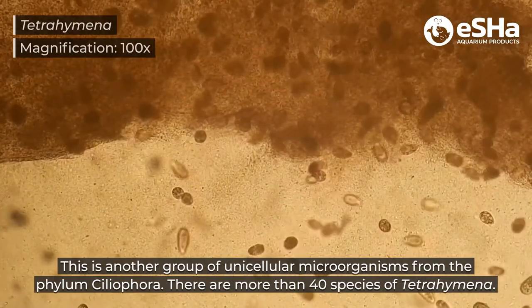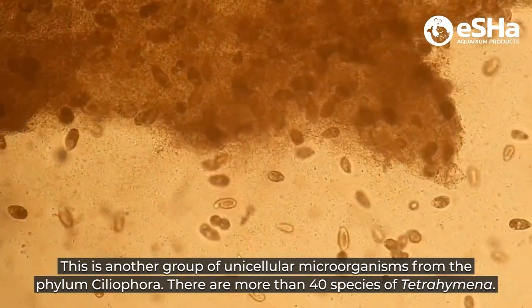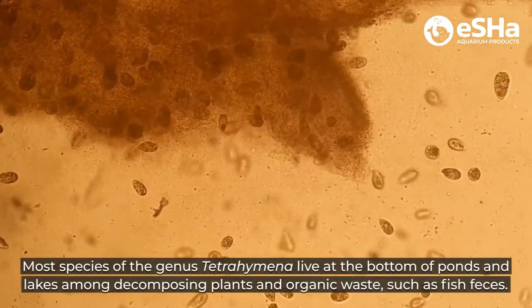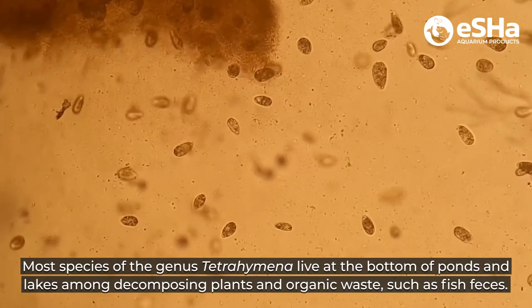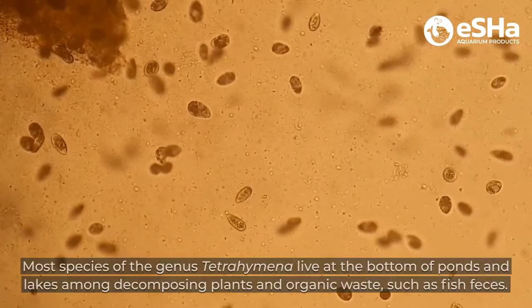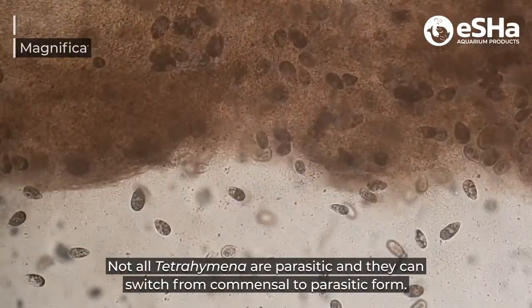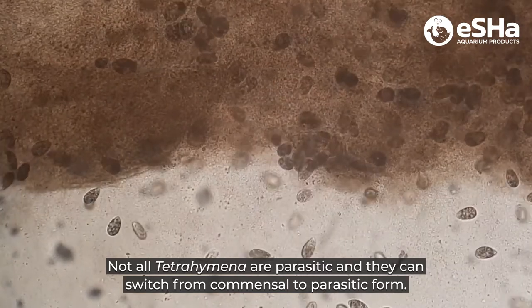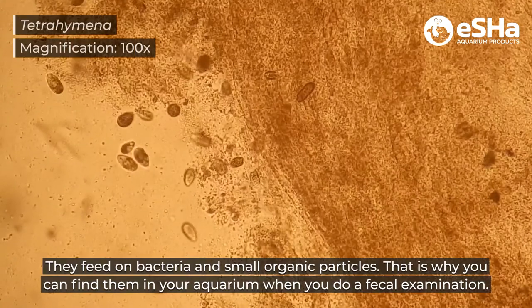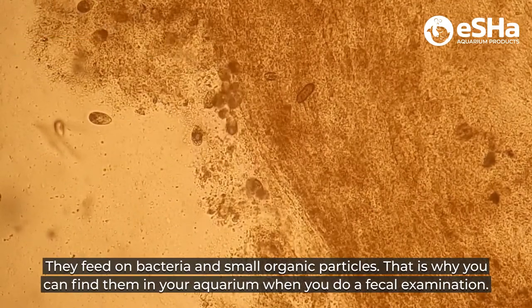This is another group of unicellular microorganisms from the phylum Ciliophora. There are more than 40 species of Tetrahymena. Most species of the genus Tetrahymena live at the bottom of ponds and lakes among decomposing plants and organic waste such as fish feces. Not all Tetrahymena are parasitic, and Tetrahymena can switch from a commensal to a parasitic form. They feed on bacteria and small organic particles, which is why you can find them in your aquarium when you do a fecal examination.